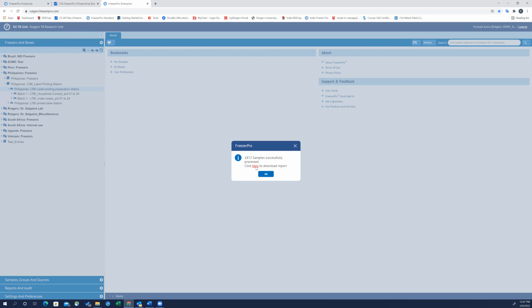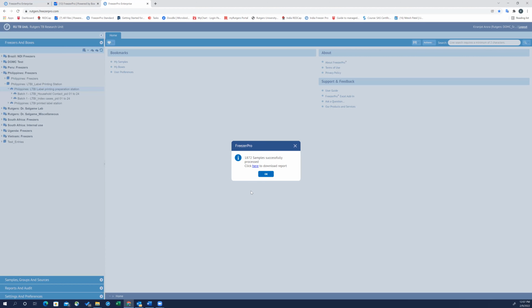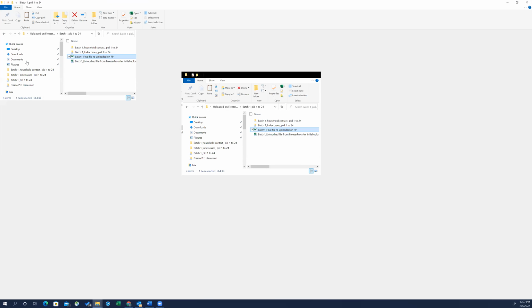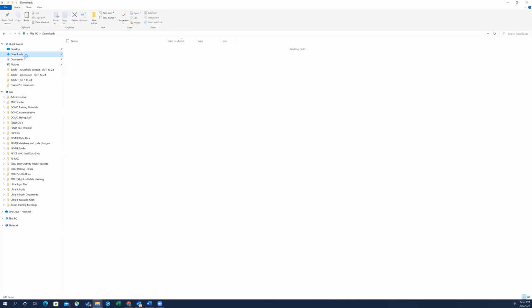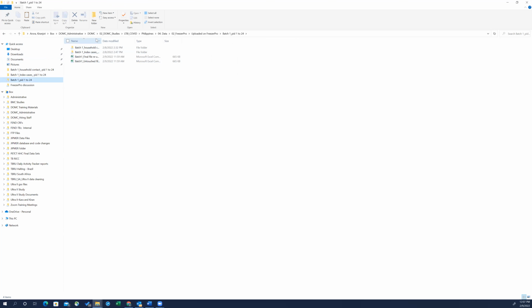All right, and then I'll just click here to download the report. There's 1,872 samples and the report is generated. So I had downloaded this before as well, so I'll show you where I saved it. You would just save that CSV file from the download folder and move it to the desired location. When you have it in the download folder, the report will be named something like this, which is a very odd name. So it's very important to change the name yourself.